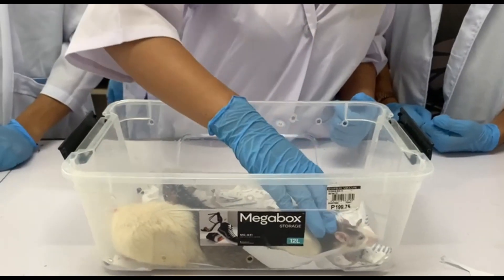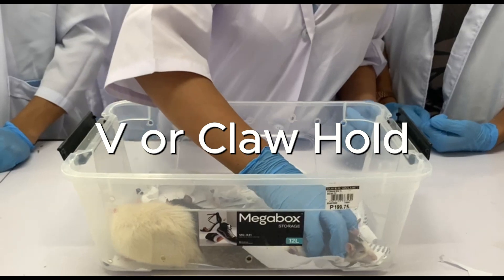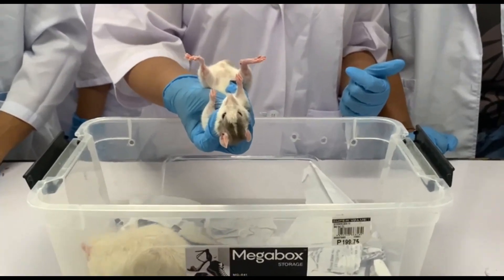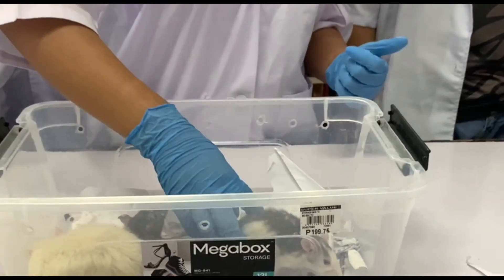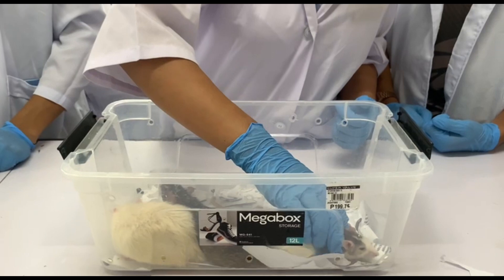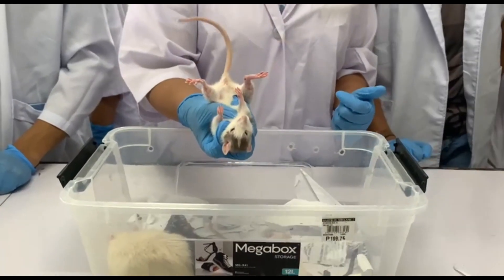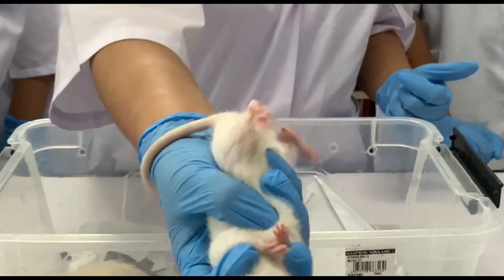For the last technique, it is the V or claw hold. Grasp the rat's tail with the dominant hand and pull back gently. Then place the rat's head between the V formed by your non-dominant hand's index and third fingers. Place the thumb under the forearm and the other fingers under the opposite forearm to support the chest. Support the tail and body with the other hand.